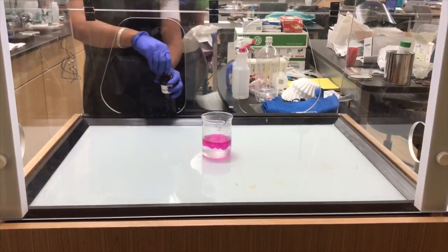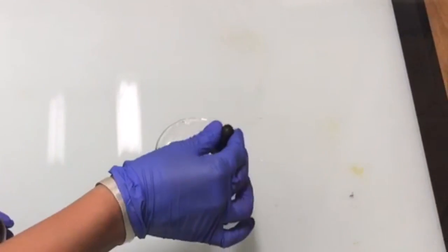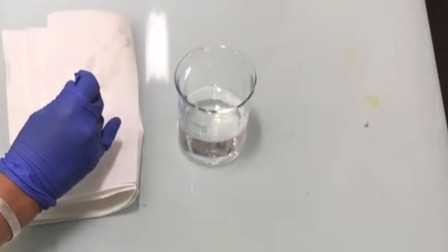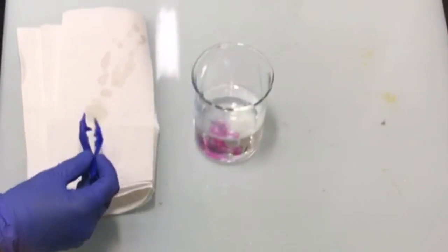In our first trial, the sodium produced more heat that ignited the hydrogen gas, causing the flame, so less sodium hydroxide was produced, resulting in the phenolphthalein only being present at the top of the beaker. The color of the flame is affected by what metal is used, so the yellow color indicates that sodium was used in the reaction.